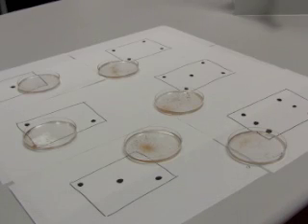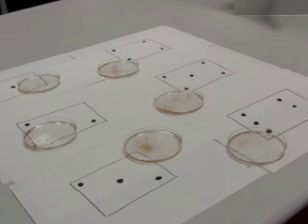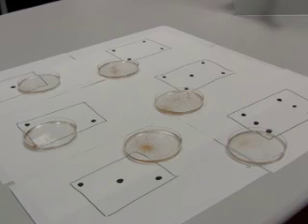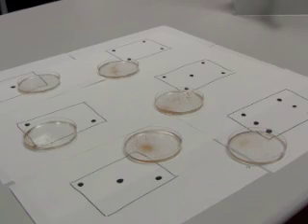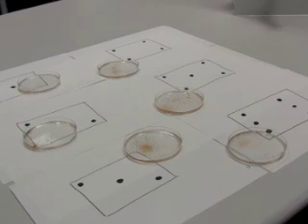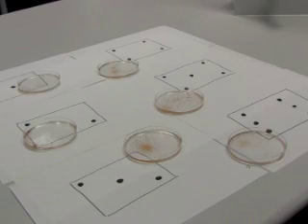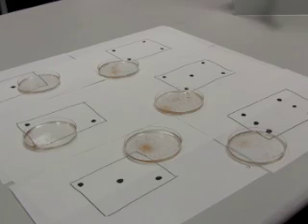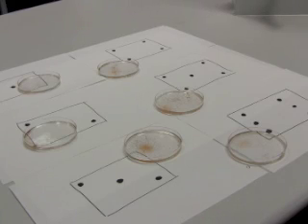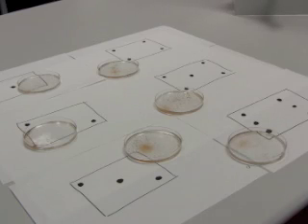SLS is a common household detergent that is often washed into our waterways. For this practical, you will be examining the effect of SLS exposure on marine life. There are six treatment groups of varying concentrations of SLS that you can see in front of you. You will be examining the effect that each of these concentrations has on the organism that we're using.